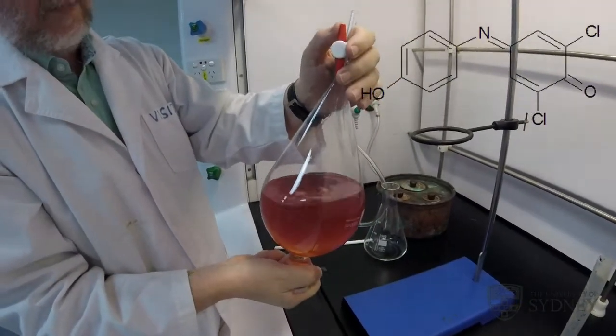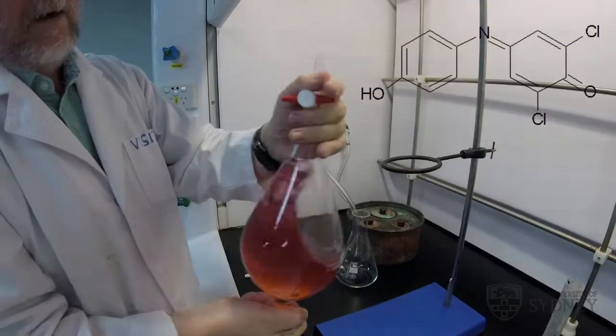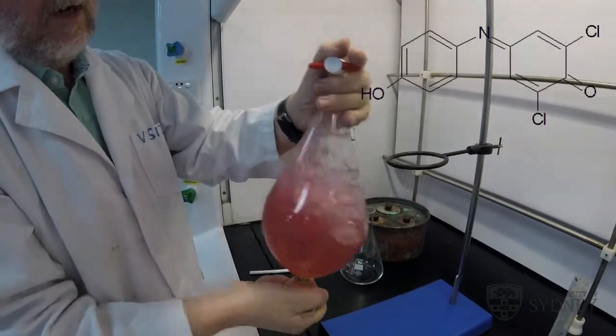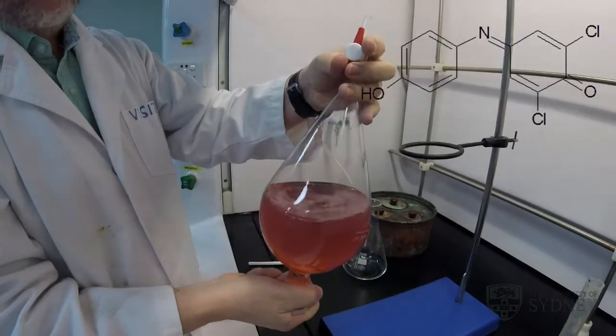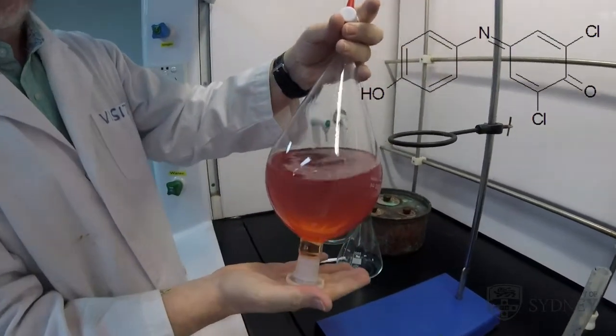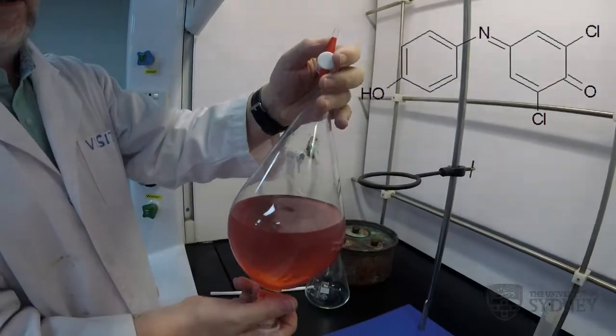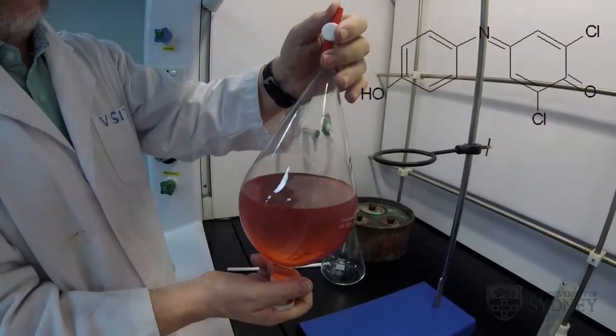Notice that I'm venting the tap here with my left hand so that any pressure build-up is released, and the cap doesn't come off the bottom and leak all over my hand, and the separatory funnel doesn't explode either.